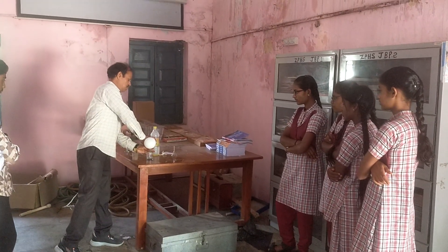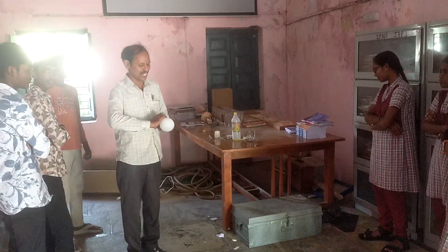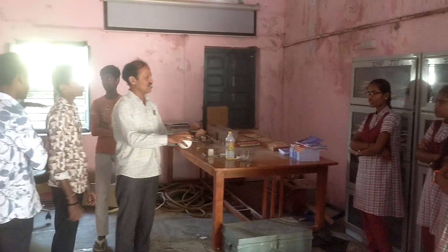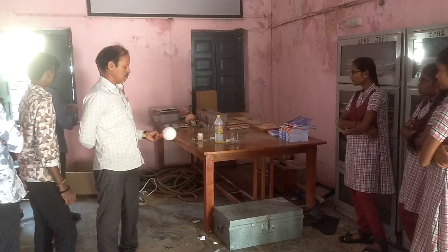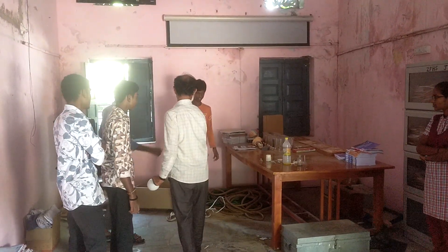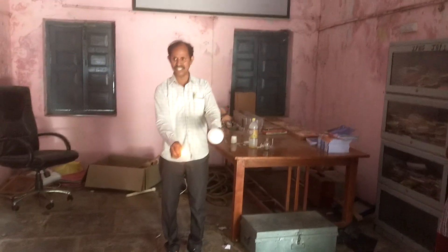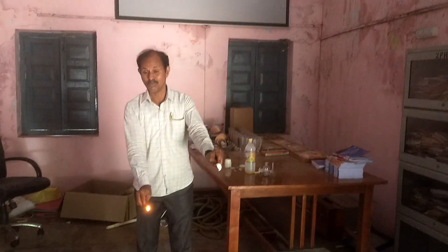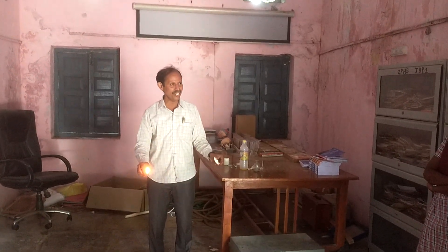Now we can remove the balloon from the reagent body. Next, we have this gas — which gas is present in this balloon? Now we can test with a burning splint. Now we can observe what happens. It burns with a pop sound. Hence the liberated gas is nothing but hydrogen gas.